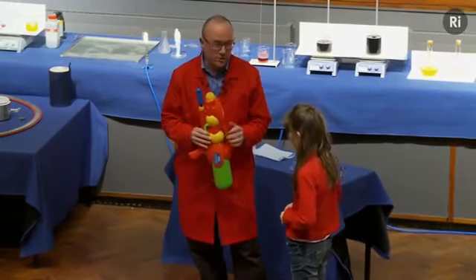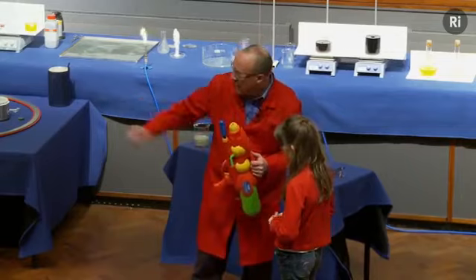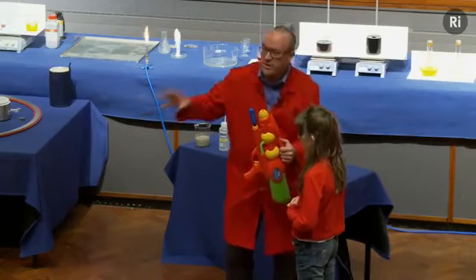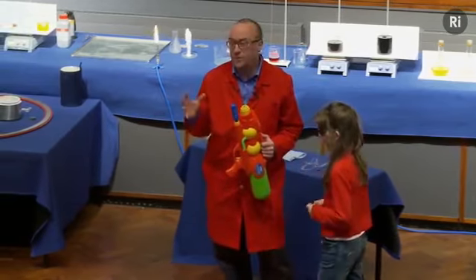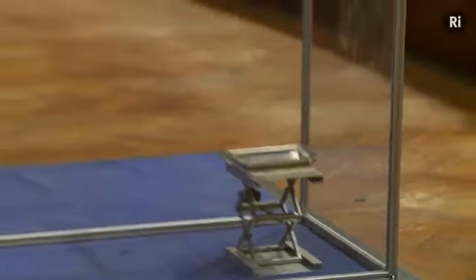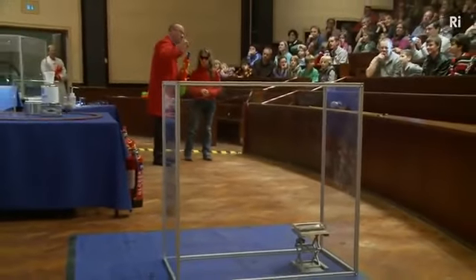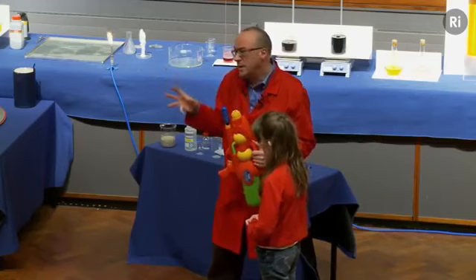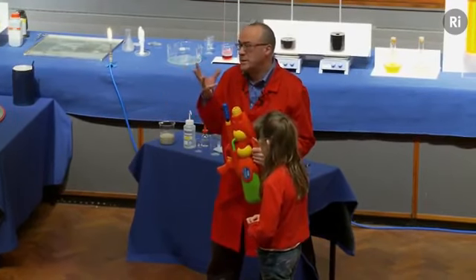And what you're going to do is to squirt the water pistol at a little metal dish. Can you see that on the little stand there? And that dish contains a mixture of silver nitrate and finely powdered magnesium. And if you can get a little bit of water to land on it, we'll see if that can start a fire. Now, because this contains magnesium, it's going to produce a very bright light.